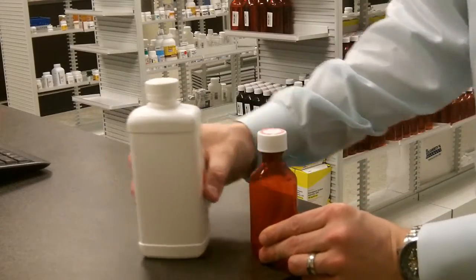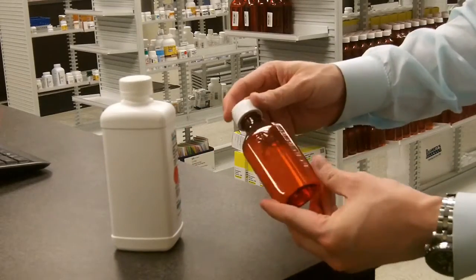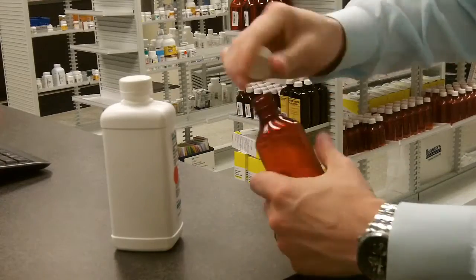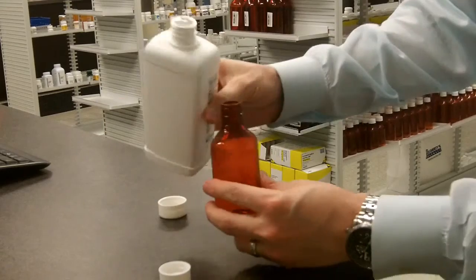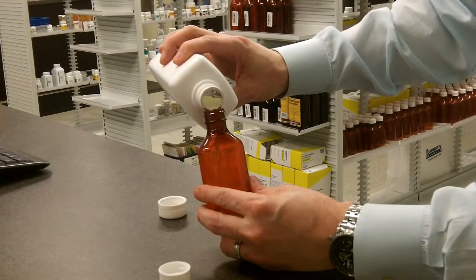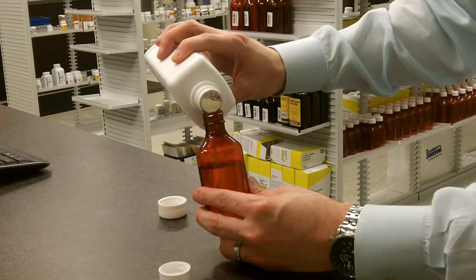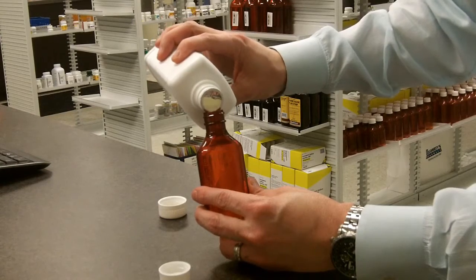Here I have a stock bottle and an empty prescription bottle — this one is four ounces. We'll learn how many milliliters that is later in the course. All I'm going to do is take the lid off both and pour. I'll pour in nice and slow right at the top — no need for a funnel — and let it go all the way up to the line that marks four ounces.